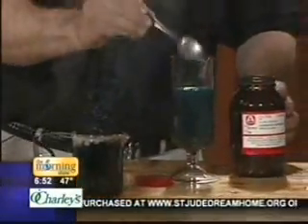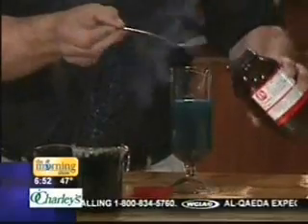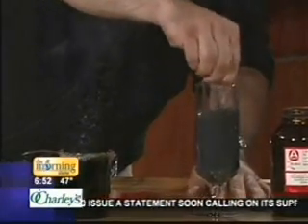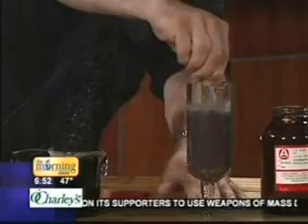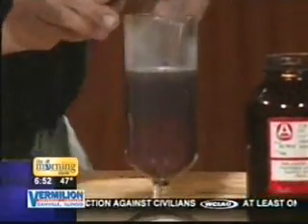Of course, we copper-plated this spoon. But let me just add a little bit more iron here, and we might be able to see the copper come out of solution down in the bottom. Sometimes these take just a little bit of time, because chemistry is, there we go. There it comes. And the copper just falls right out. I see it down there at the bottom. Yep, and they actually do this in the industry.